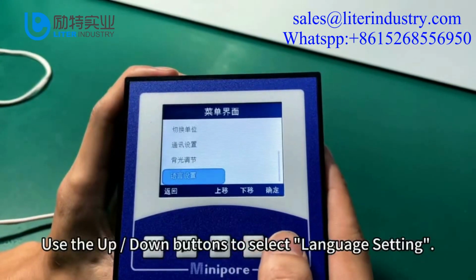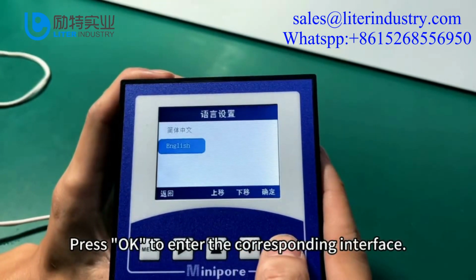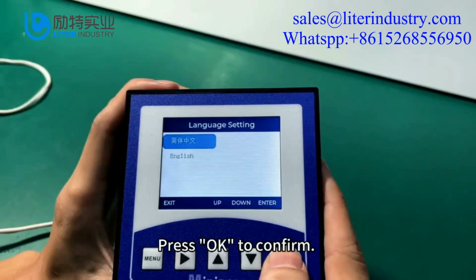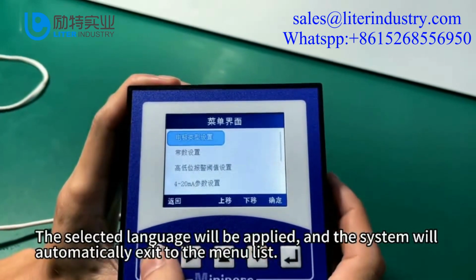Use the up-down buttons to select language setting. Press OK to enter the corresponding interface. On the language setting interface, use the up-down buttons to select the desired language. Press OK to confirm. The selected language will be applied and the system will automatically exit to the menu list.